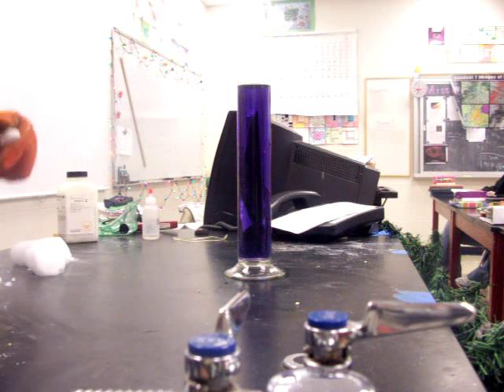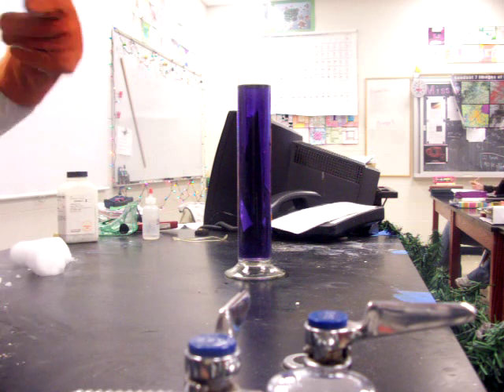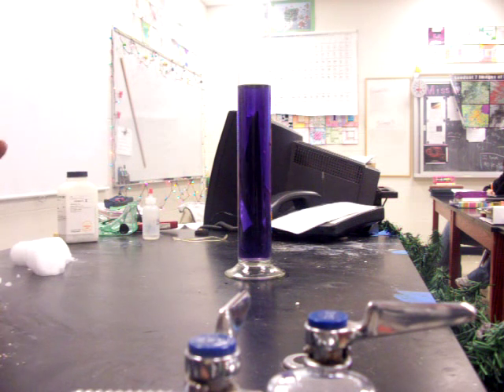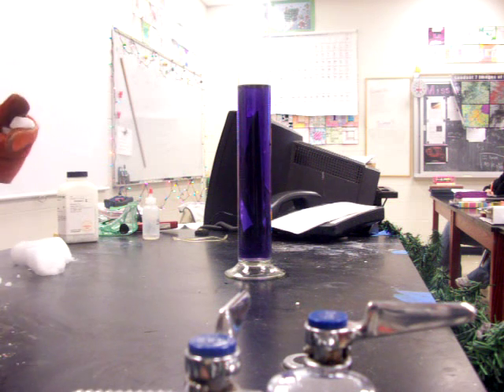Here we have a graduated cylinder. I filled it with water, added some universal indicator solution, which was a green color, and then used a base, in this case sodium hydroxide, to get us into the basic color range for this indicator.